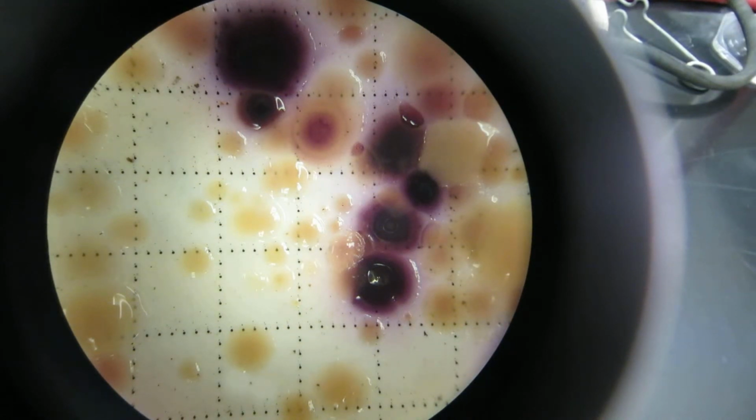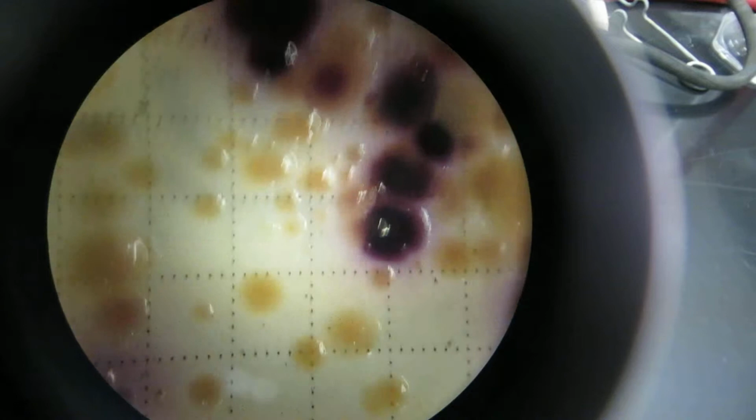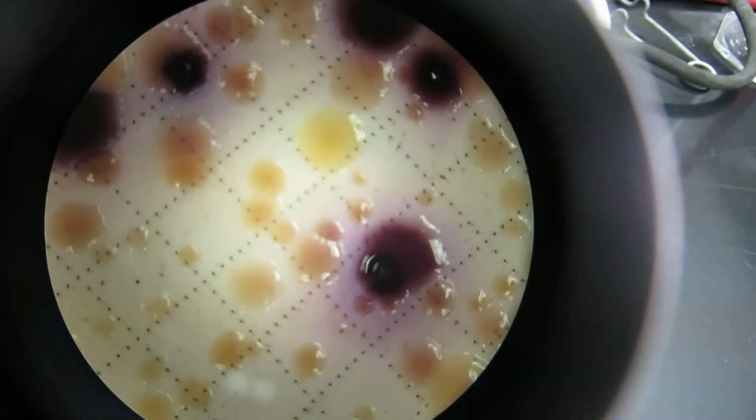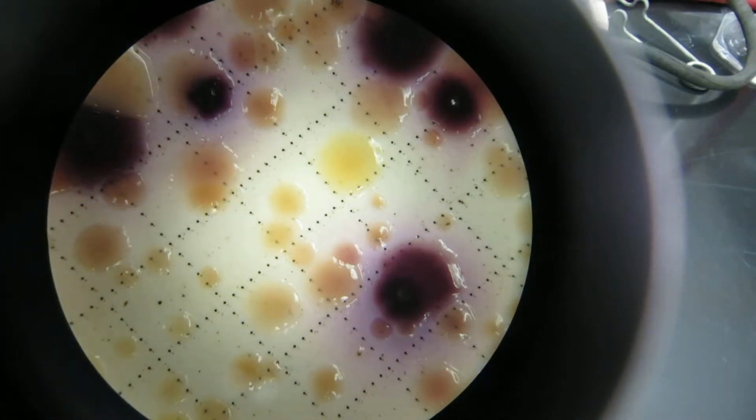So I took about 100 milliliters of water and I made some dilutions. I wrote the dilutions on the back here. This one is about 10 to the negative 2 dilution. That means I took 100 milliliters of the water sample and then I diluted it 2 times, 2 tenfold dilutions. Anyway, I wanted to show you this mTEC here.